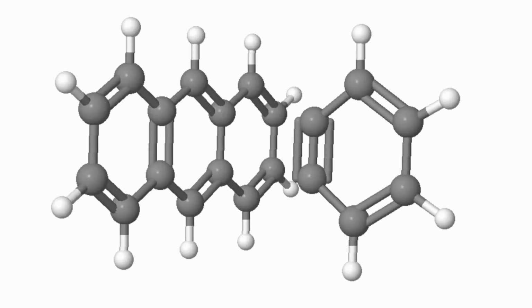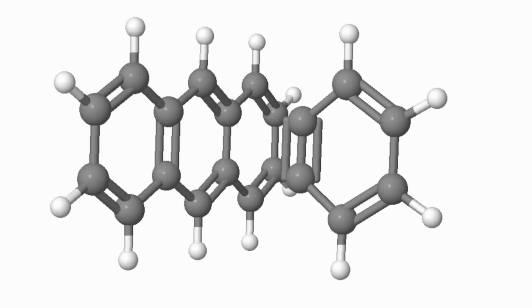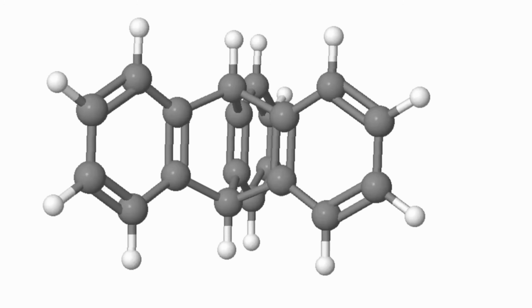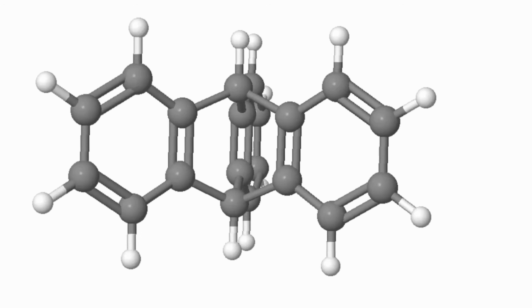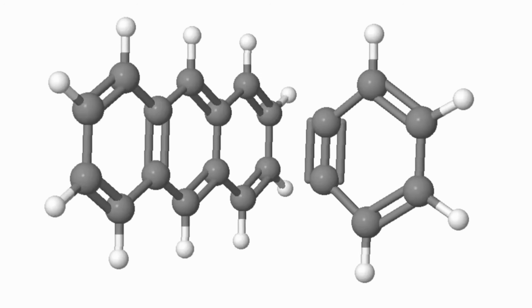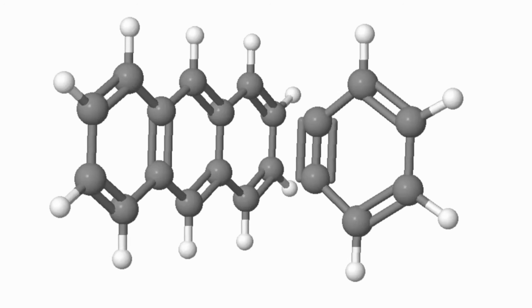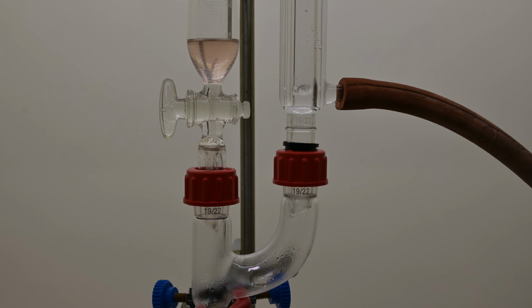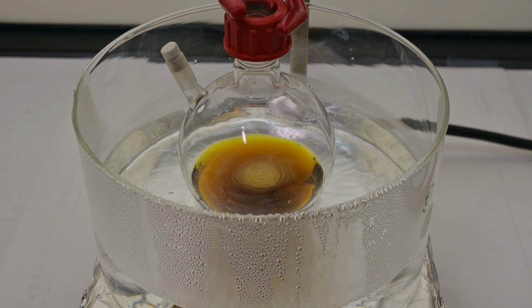Think of it as 2 dance partners coming together in a perfectly timed move. Part of the anthracene and benzyne join to form a new 6-membered ring. This new bond is a key building block in the triptycene molecule. The whole process is carefully controlled by slowly adding anthranilic acid and using extra n-butyl nitrite, ensuring that benzyne is generated right where it's needed and reacts immediately with anthracene.